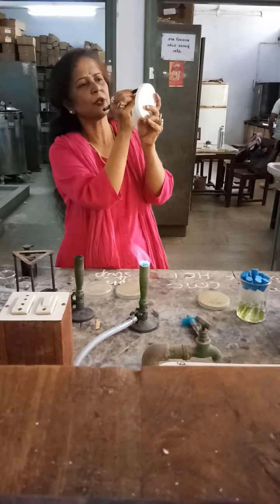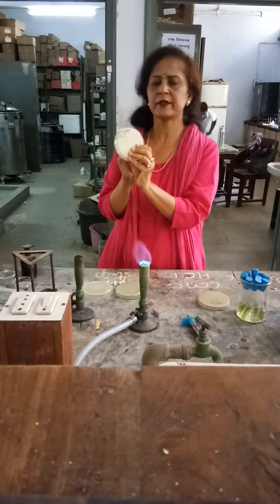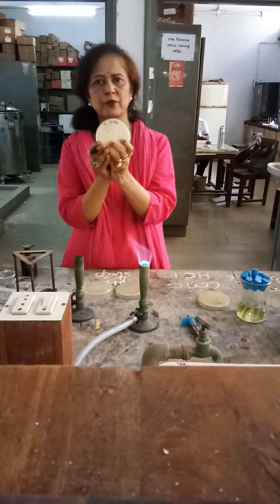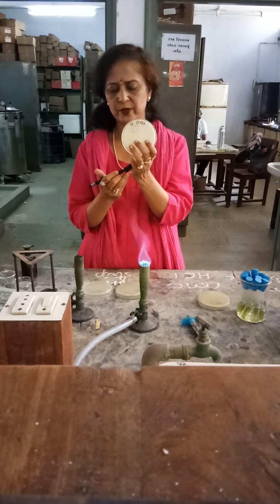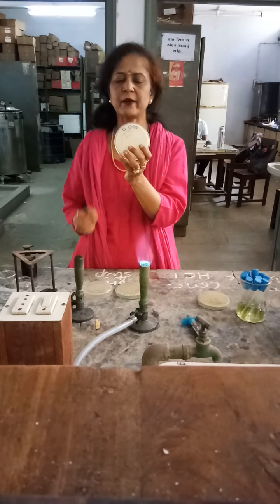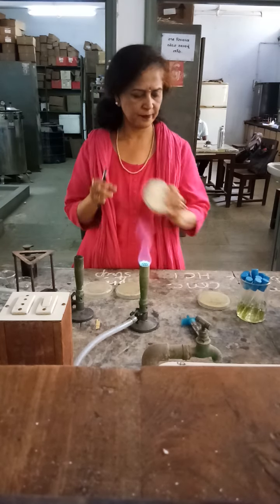Because this is a soil sample, you can see so many different colonies in which there will be this type of clear zone formation. That is the result of the calcium carbonate agar plate. There are so many organic acid-producing bacteria present in our natural soil sample, and they have given clear zones.